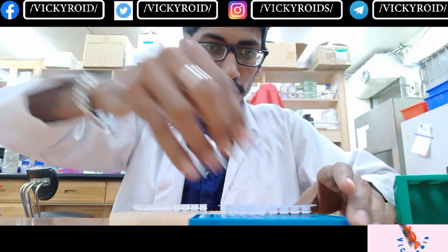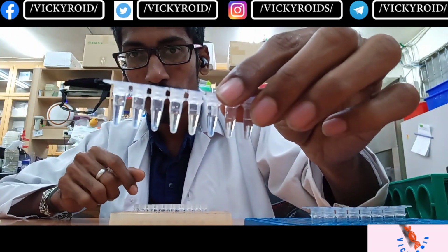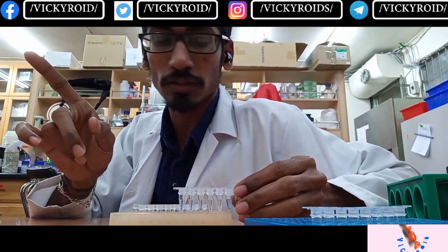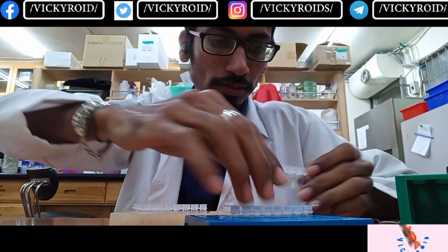So after this, we are going to add 2 microliters of the DNA to each tube. This is the DNA that I have already isolated from video number 1. If you wish, you can go back to video 1, watch it, and come back.